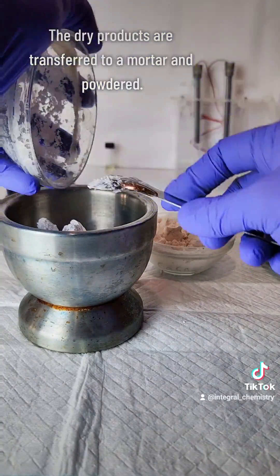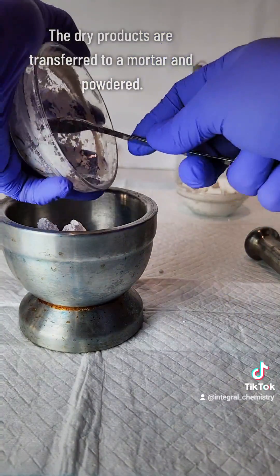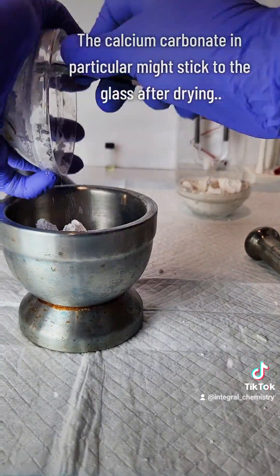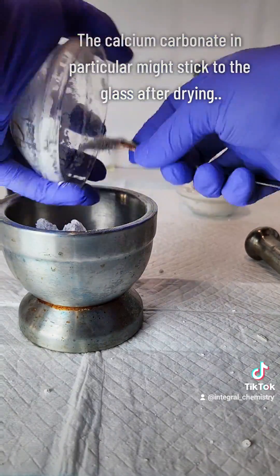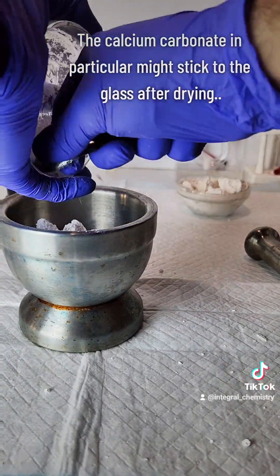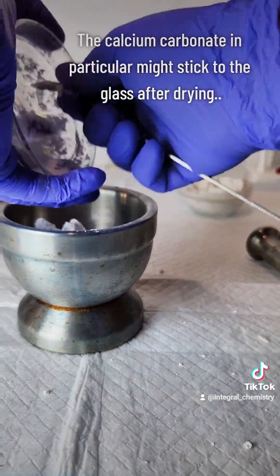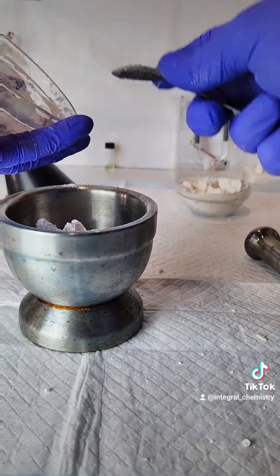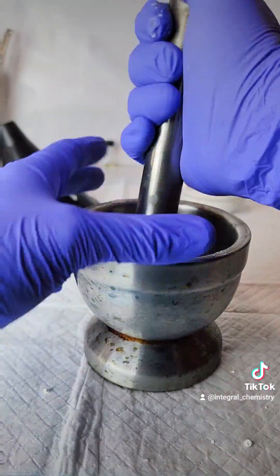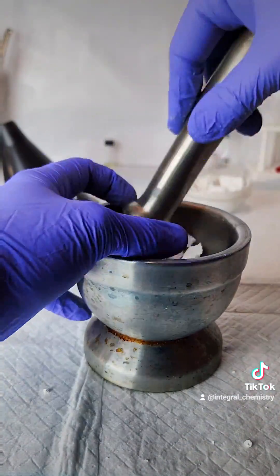Calcium carbonate in particular has a tendency to adhere very stubbornly to glass surfaces, so keep that in mind. After each one is thoroughly powdered, the process is done, and I can transfer each one to its respective storage vessel.